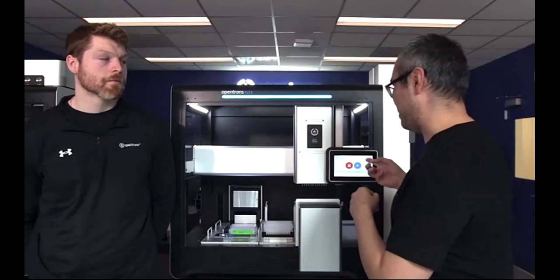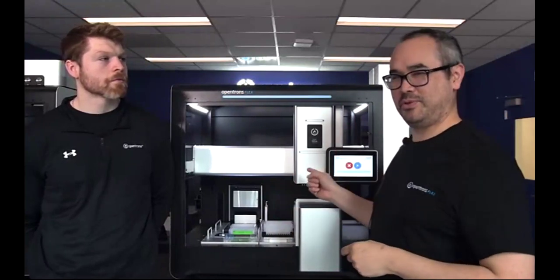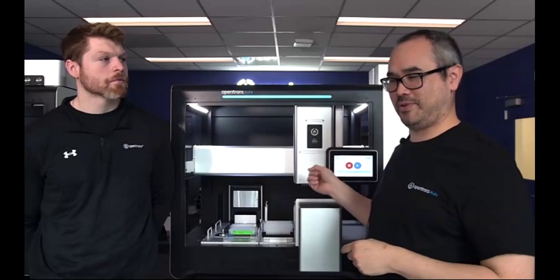You could have a separate protocol on the Flex itself using the same labware and everything to do a reagent setup, but I just did it myself on the OT2 separately. It's a little more time invested in setting up a reagent plate rather than just taking reagents directly out of the kit, but it gives a smooth, fast run on the actual library prep on the robot. Yeah. Great. Thank you so much.